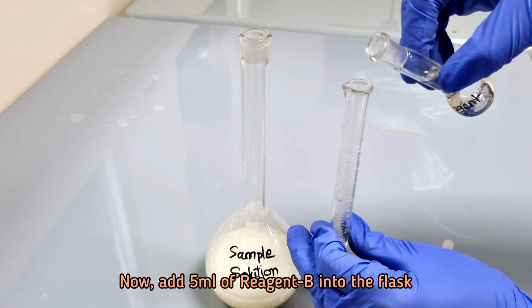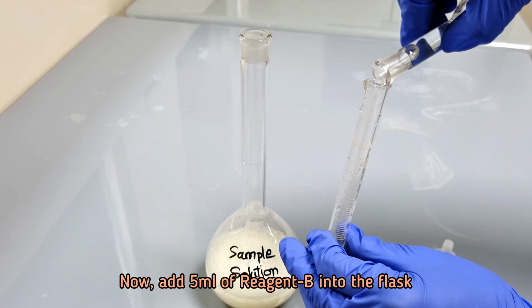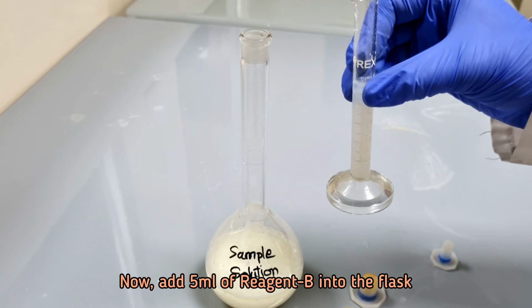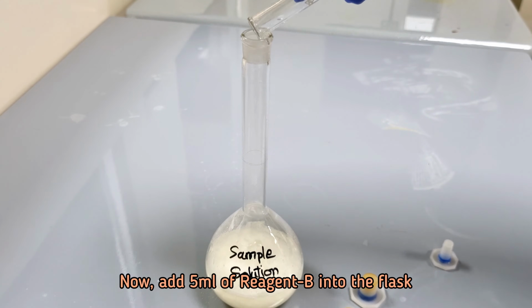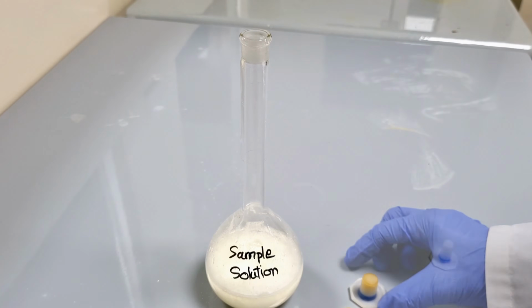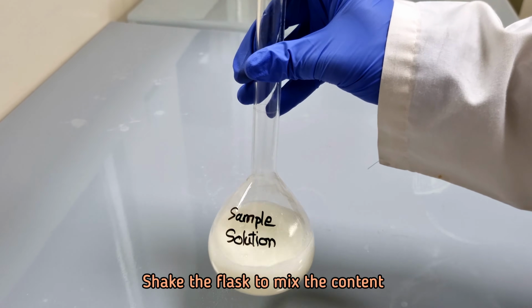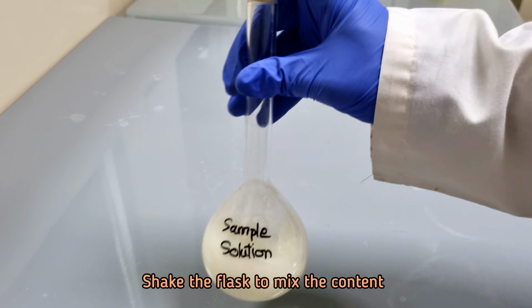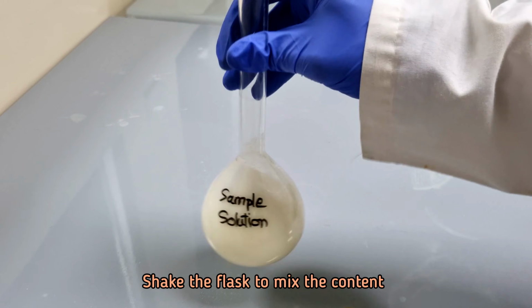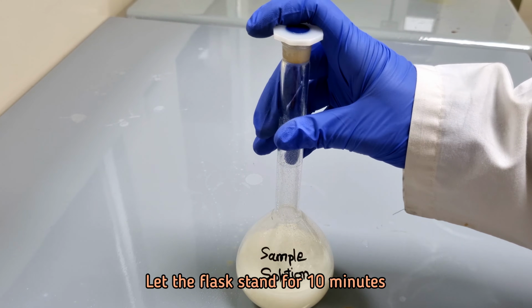Now add 5 ml of Reagent B into the flask. Let the flask stand for 10 minutes.